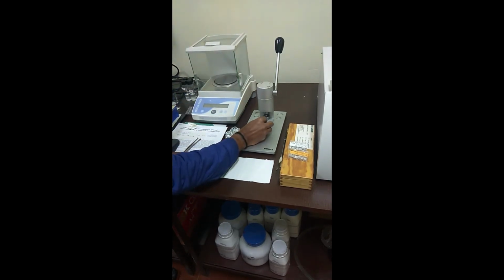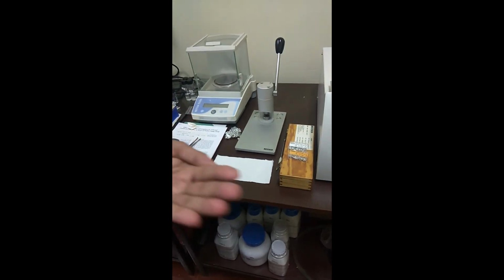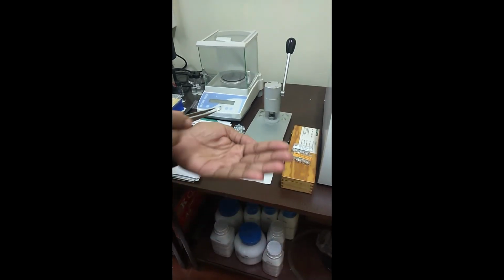Once the sealing is done, we'll bring back our crucible to the desired location, and if you look, the properly packed crucible looks like this. We will now take the sample crucible out. This is the previously loaded sample crucible, and we will now place the freshly made crucible which is having our new sample, and we will place it in the sample slot.